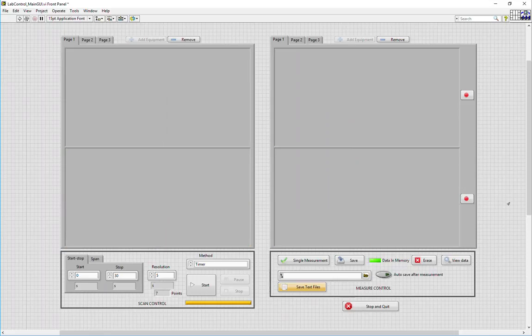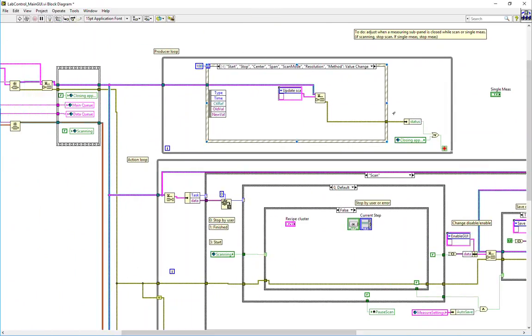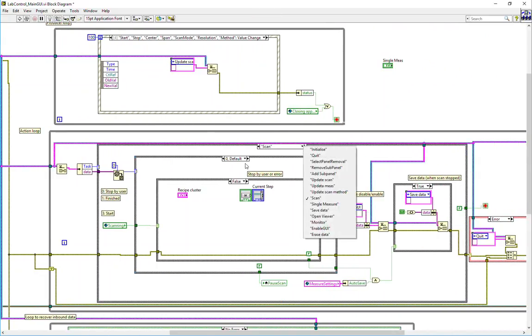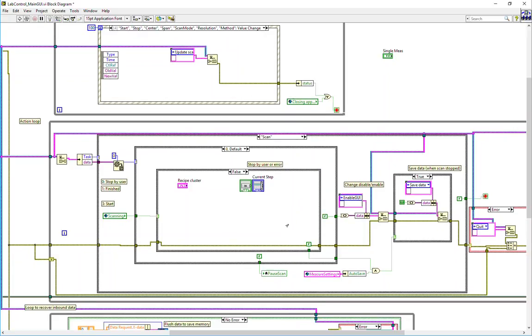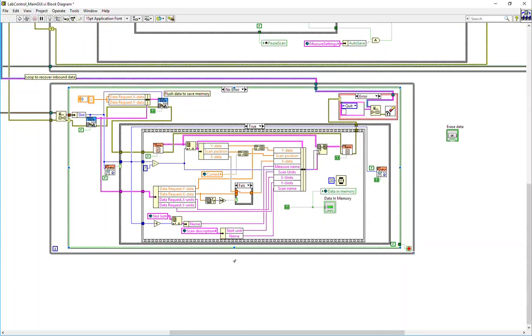As for the architecture of the main GUI, it has a similar form. An event task that selects what happens when you press any button. A task loop, which executes the action loop, which executes the different tasks which are generated. In this specific case, there's also a refreshing task for data recovery. So this specific task is simply constantly waiting whether or not data is available.